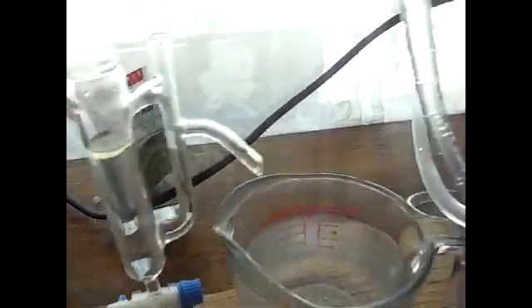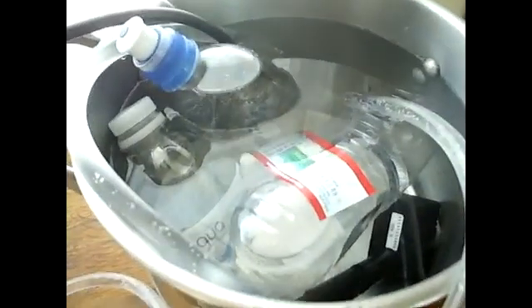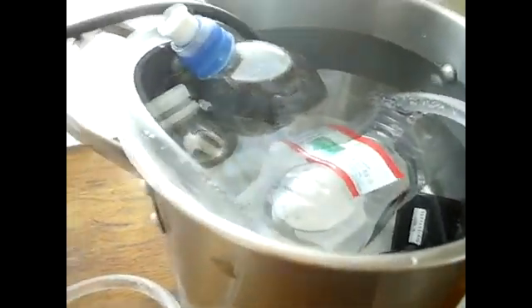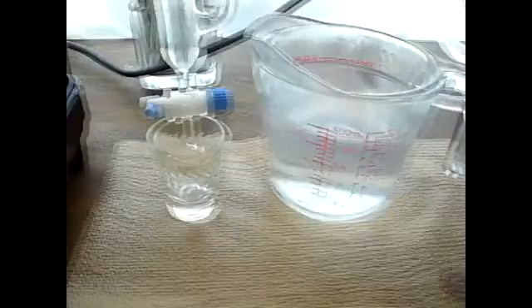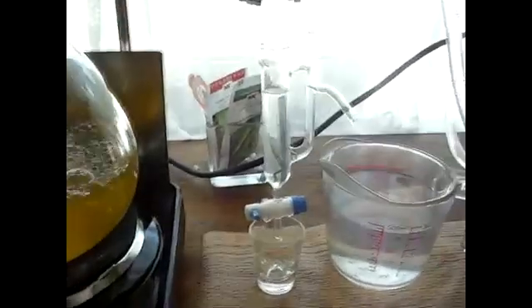There's the whole thing. I'm turning everything off. The ice bottles have melted, the water's warm. I've got almost eight ounces of hydrosol, and I've got a very small amount of essential oil here from the cedar, or thuja leaves, which I will be collecting.